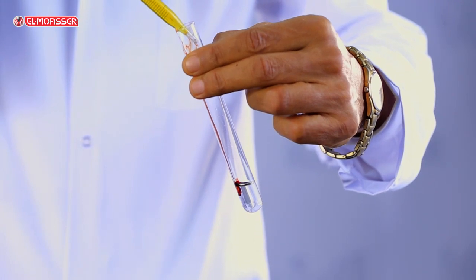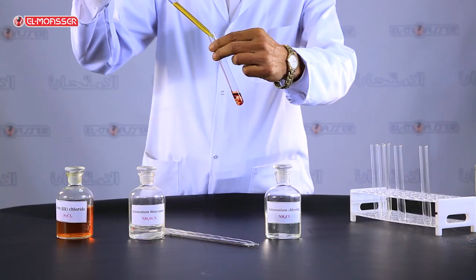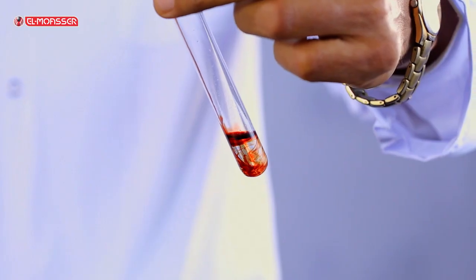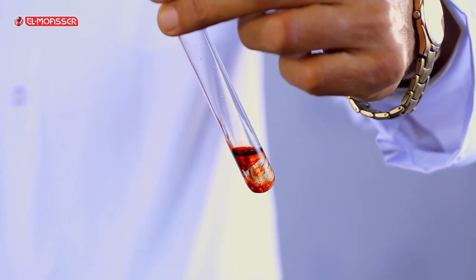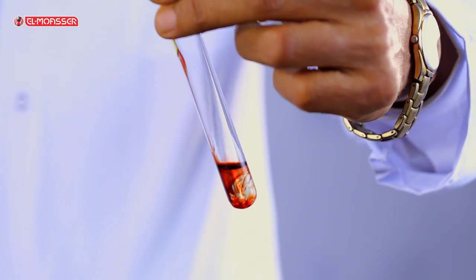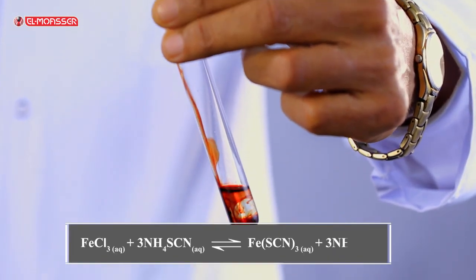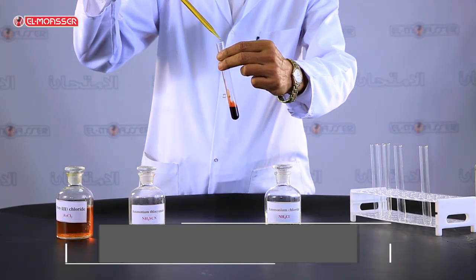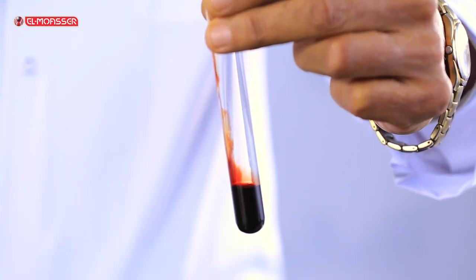What do you observe? The reaction activates in the forward direction, which is indicated by the color of the solution changing into blood red — the color of iron(III) thiocyanate solution, one of the products. The intensity of the red color increases by increasing the concentration of iron(III) chloride solution.